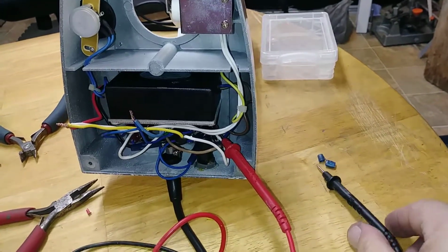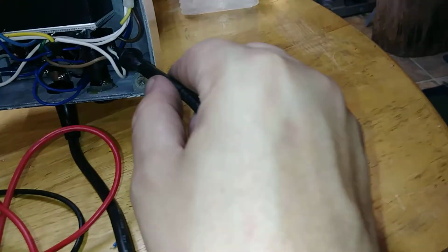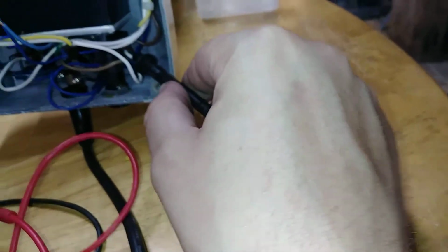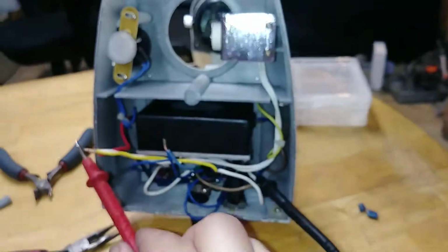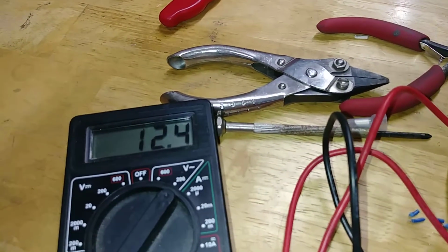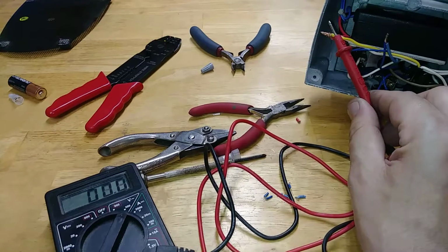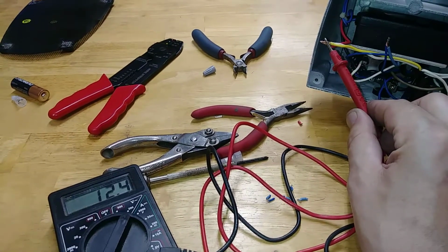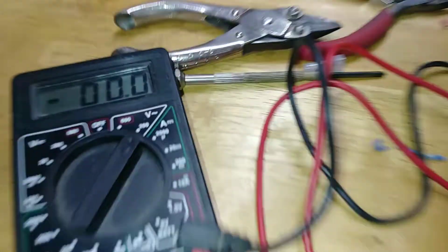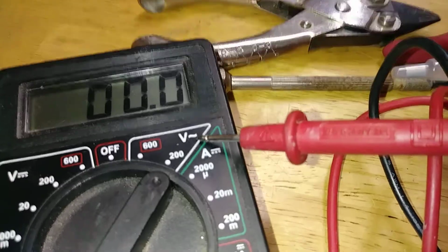I take this off. I put this one down. I stick this one directly on the same hot lead, and then stick this back onto the source. Now all of a sudden, what's going on? Why is there voltage? Take it off. It's gone. Touch it. Take it off. Touch it. Take it off.